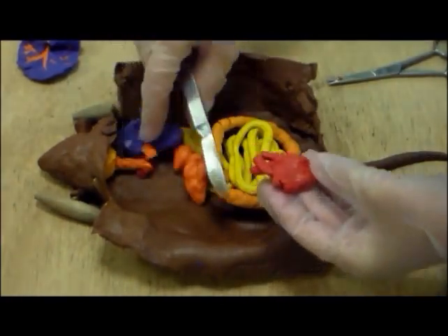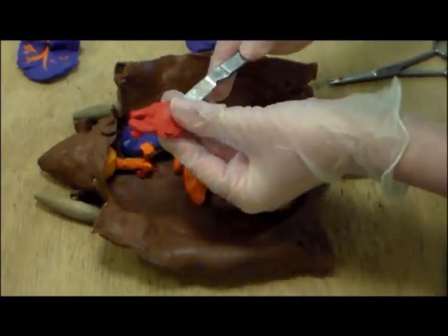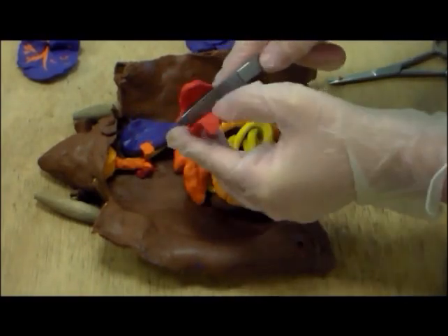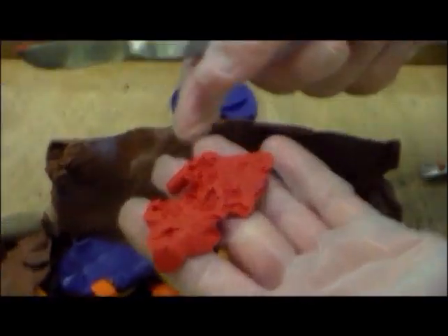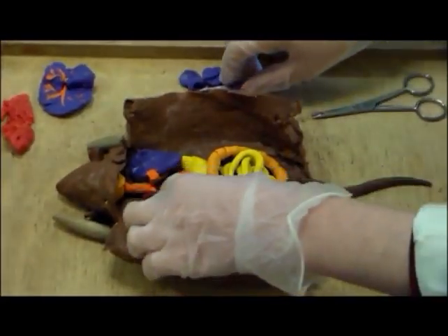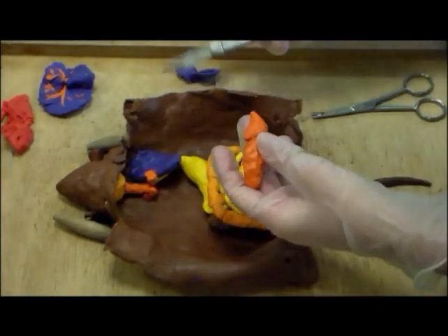Cut the heart. You can see the inferior vena cava, aorta, pulmonary vein, and pulmonary artery. On the inside you can see the atria and the ventricle.